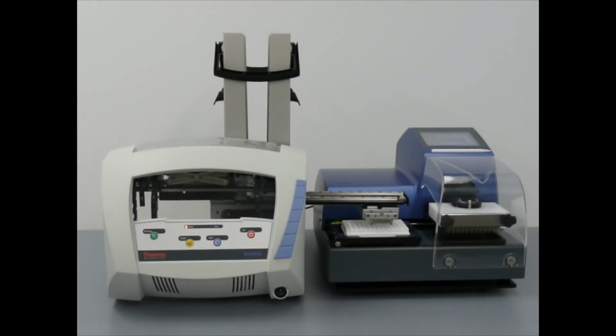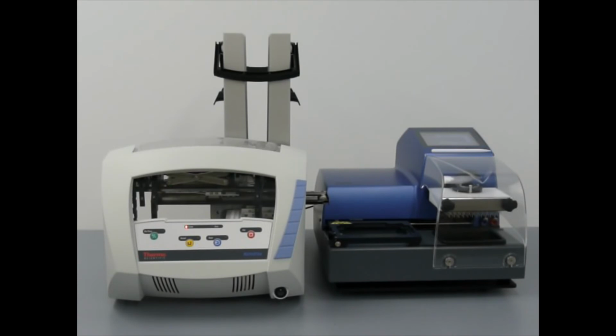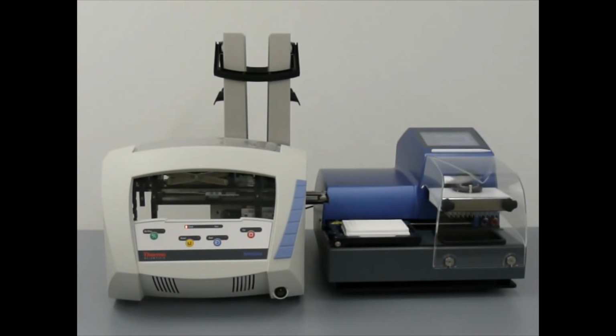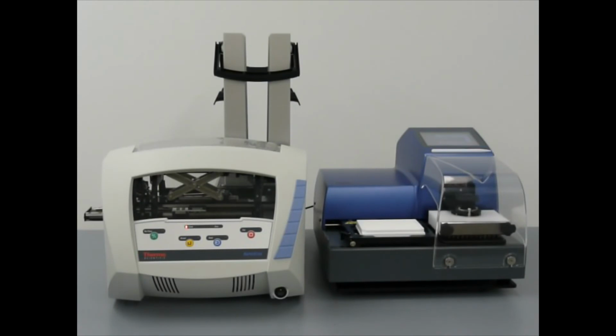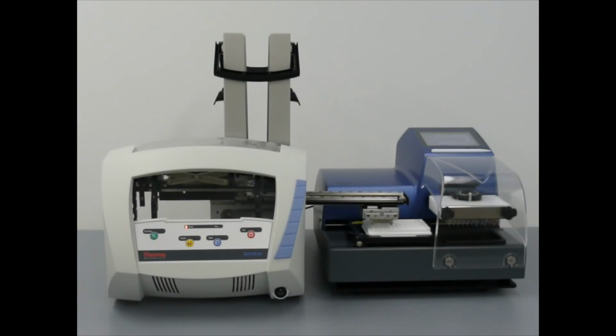Here we have the actual equipment view of the RapidStak running with the HydroSpeed. The RapidStak has just run its process on a plate, and it's about to load it with another plate. Here you can see the HydroSpeed prepping for the plate, and the RapidStak has also prepped another plate and it's staging it.